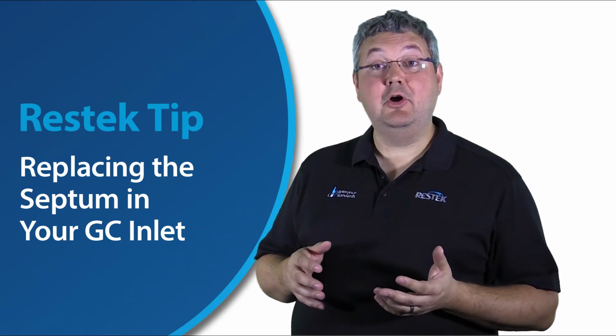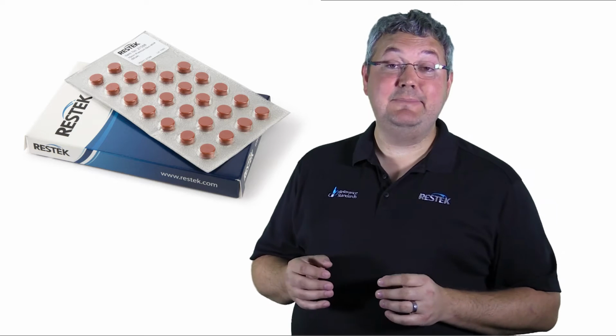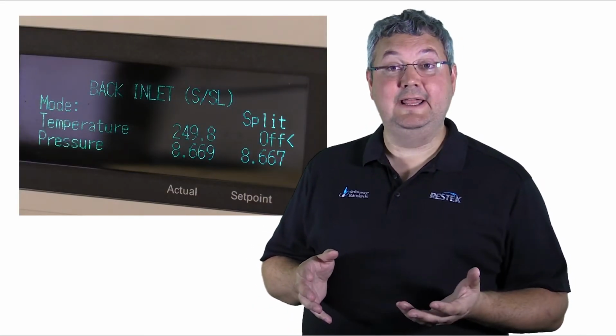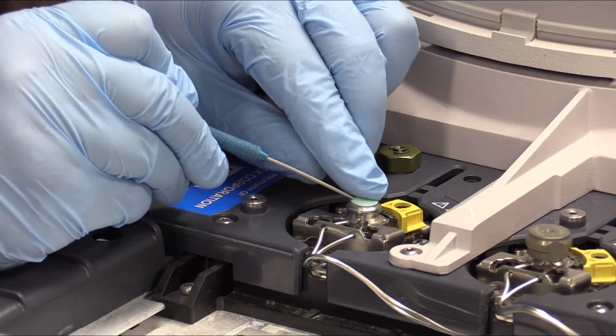In this video, we are going to replace our GC inlet septum, one of the most common maintenance tasks that we perform. Like a lot of GC maintenance, we want to make sure that we cool things off first. Cool down our inlet, and when it is cool enough to work with, we can go ahead and remove the septum nut, and then use a tool to pop out the old used septum.